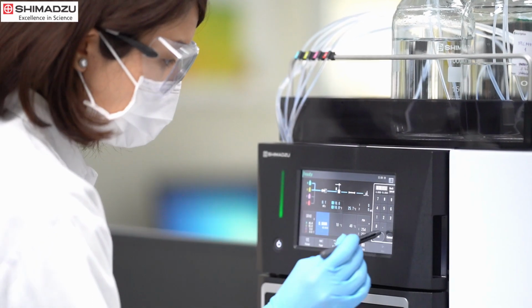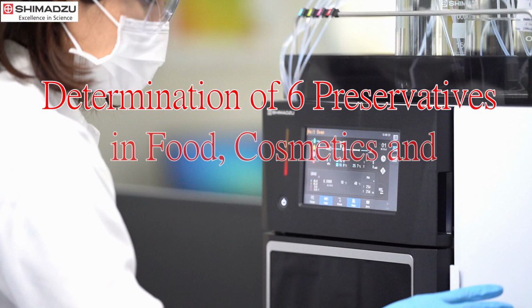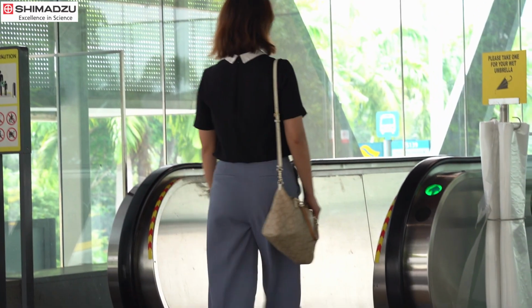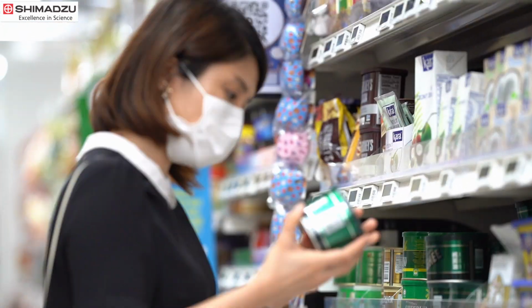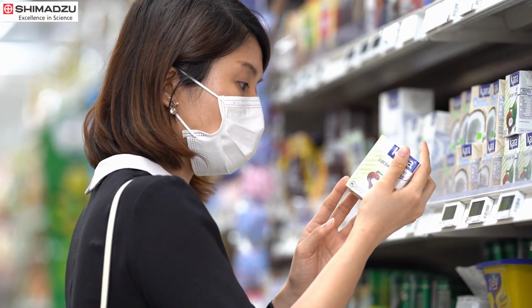In this video, I'm going to share the determination of 6 preservatives in food, cosmetics, and personal care products. When we go to the supermarket, we will check the ingredients and nutrition labels of the food and consumer products. With respect to consumers' health, it is important to control the amount of preservatives in the food products.